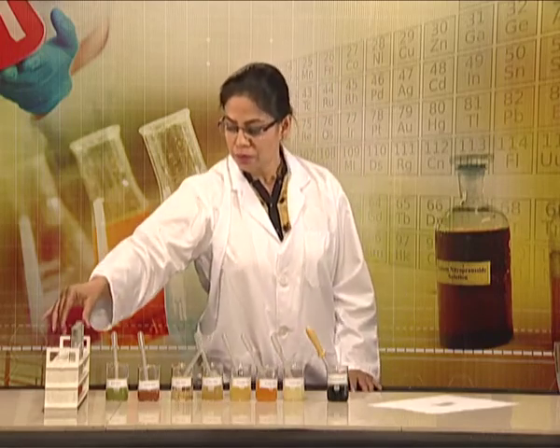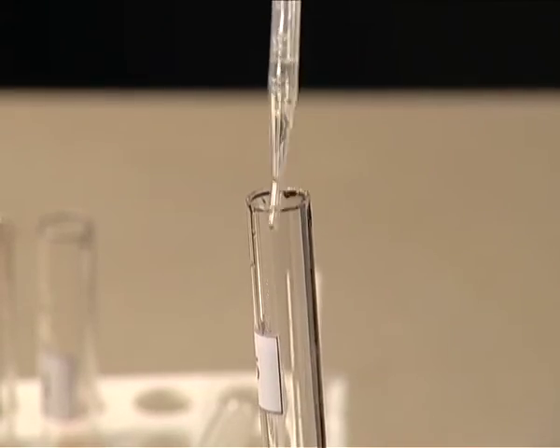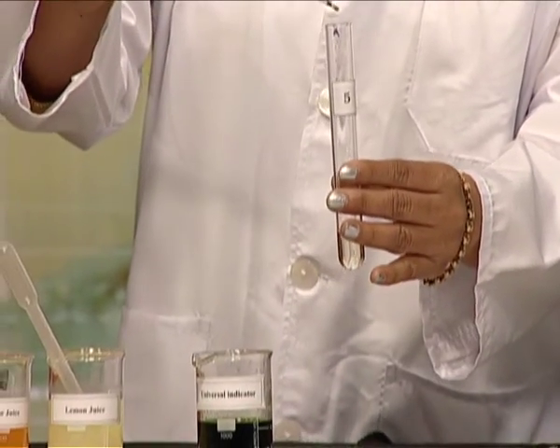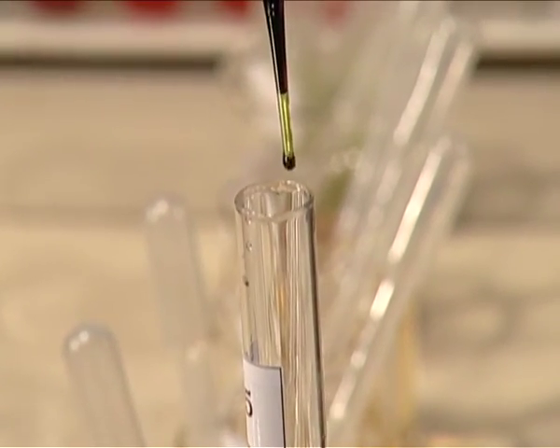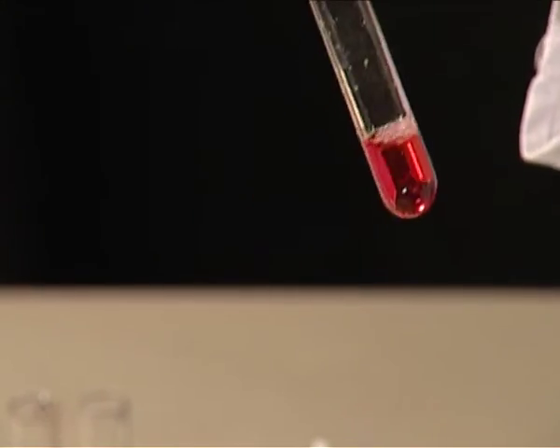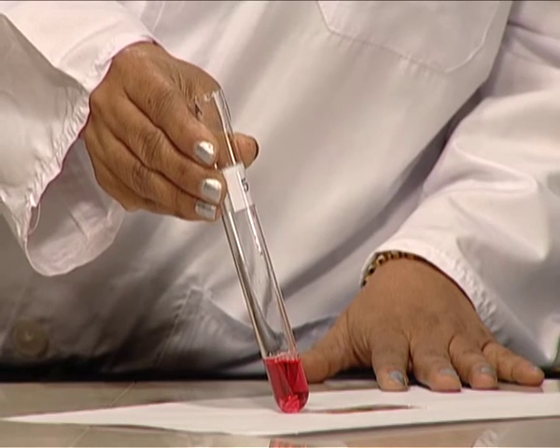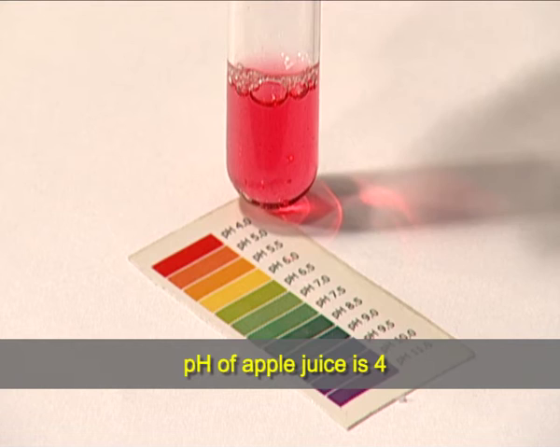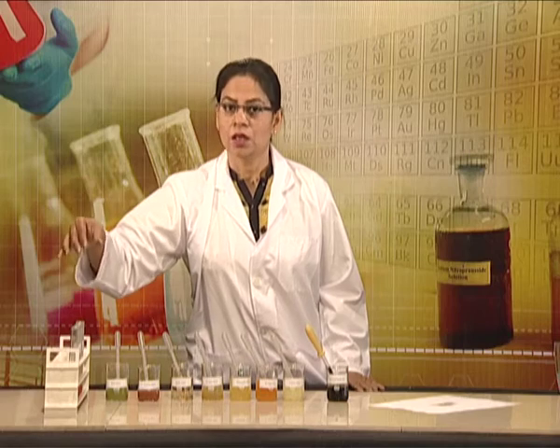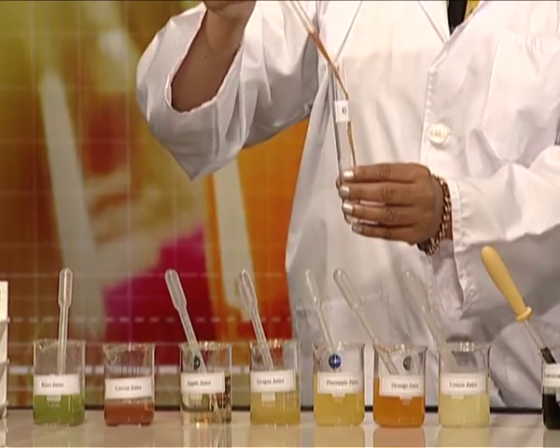Let us take test tube number 5 and add apple juice in it. Adding 2-3 drops of universal indicator, shake it well. Let us match with the pH chart. The test tube number 5 in which apple juice has been taken shows red color with universal indicator and pH range is nearly 4.